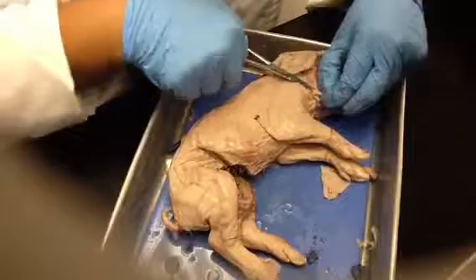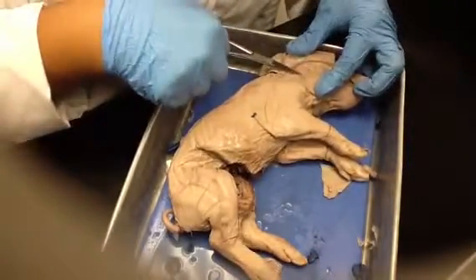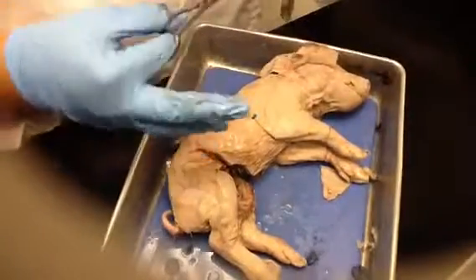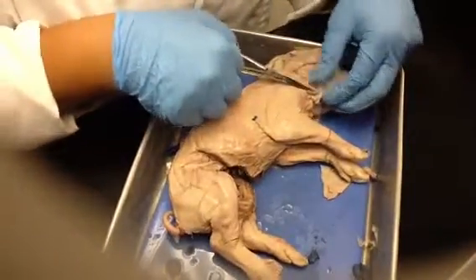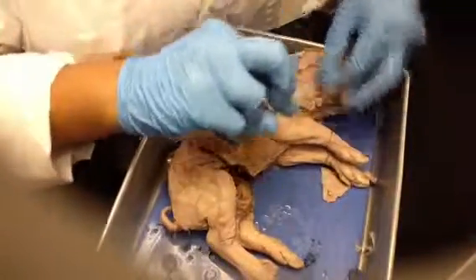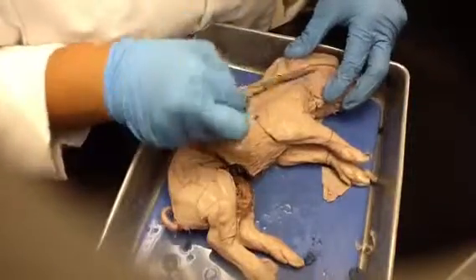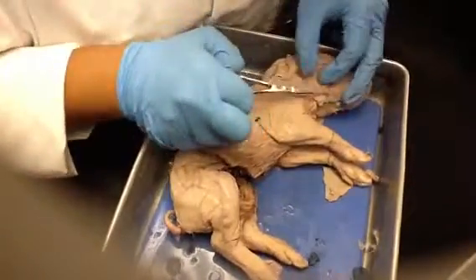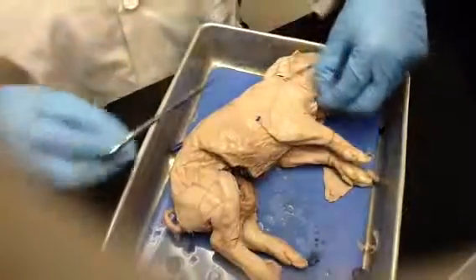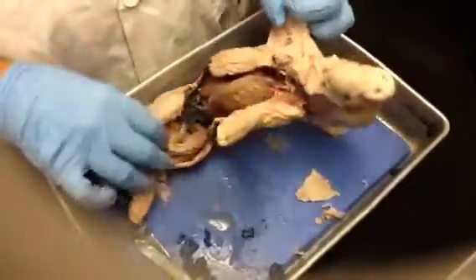But here you can also see a little bit more of the parotid gland. I know it's kind of diffuse. It's really not as together a structure as you would think it is. Really just kind of spread out. So that's definitely part of it right there. That's the parotid gland. You see it looks kind of chunky. So we'll just leave that there for the parotid gland on that side, but the facial nerve, I cut it again.